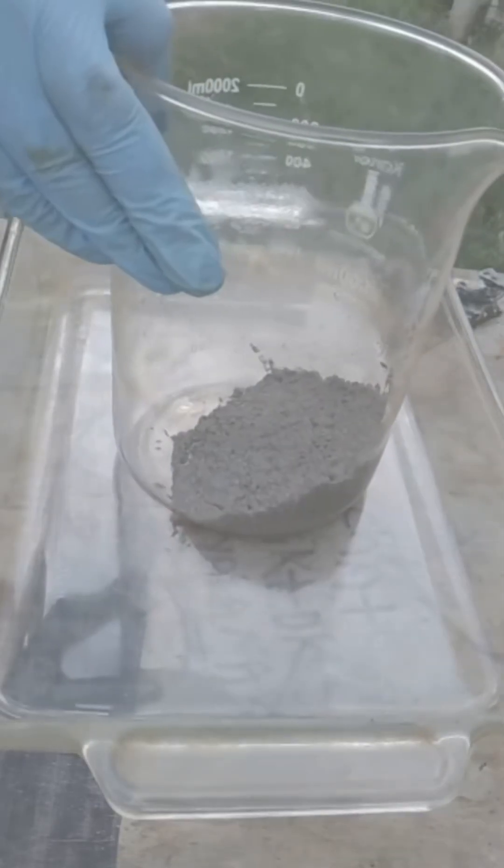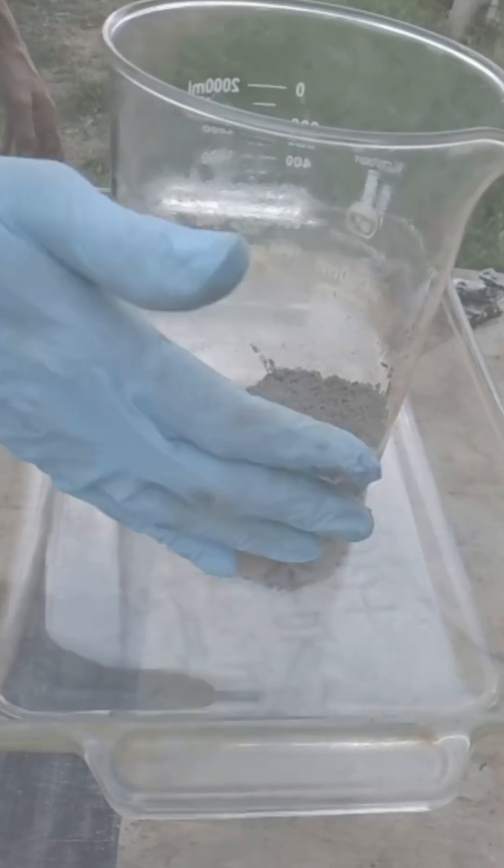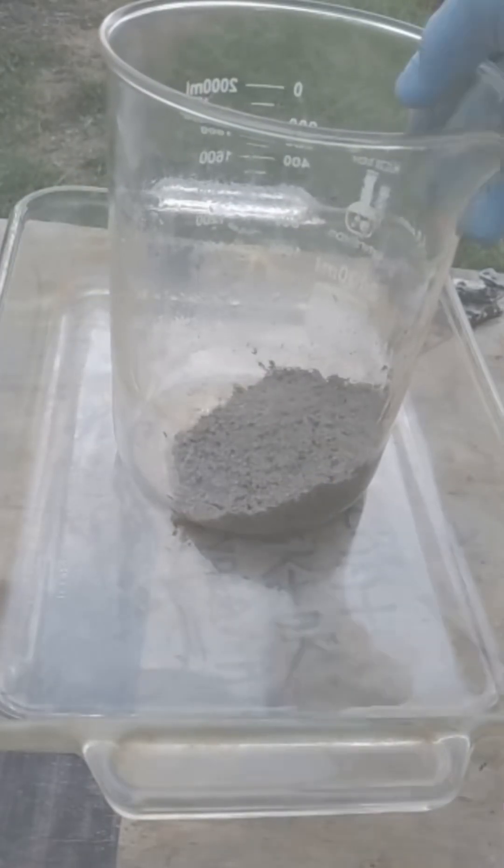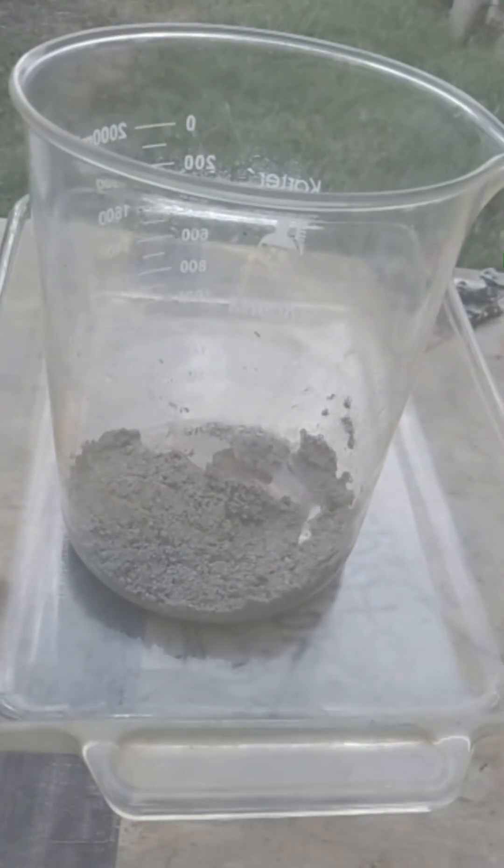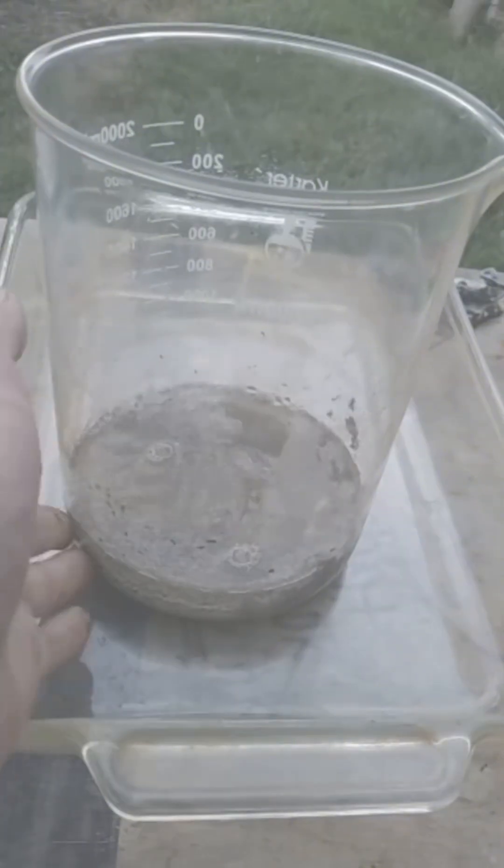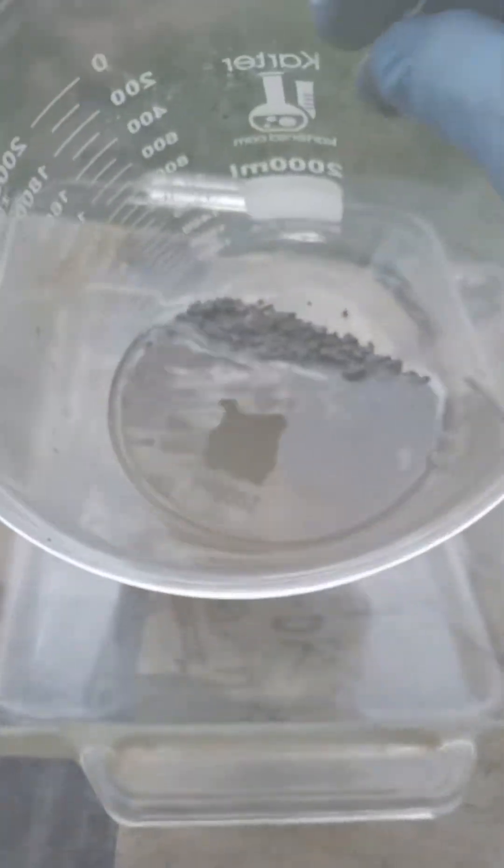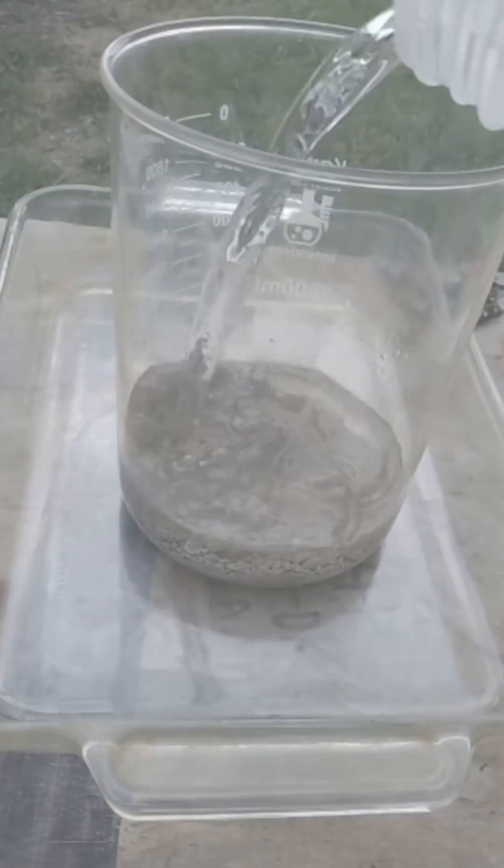Okay, now that this process is now done, what I'm going to do is I'm just going to do the same thing with the rinse and repeat. I'm going to get all the chemicals off of my powder. We are practically done. This is 24 karat—oh, not 24 karat. This is .999 silver. I'm so used to my gold, but this is .999 silver. You can go ahead and either throw it in a furnace or a crucible and melt it on down.